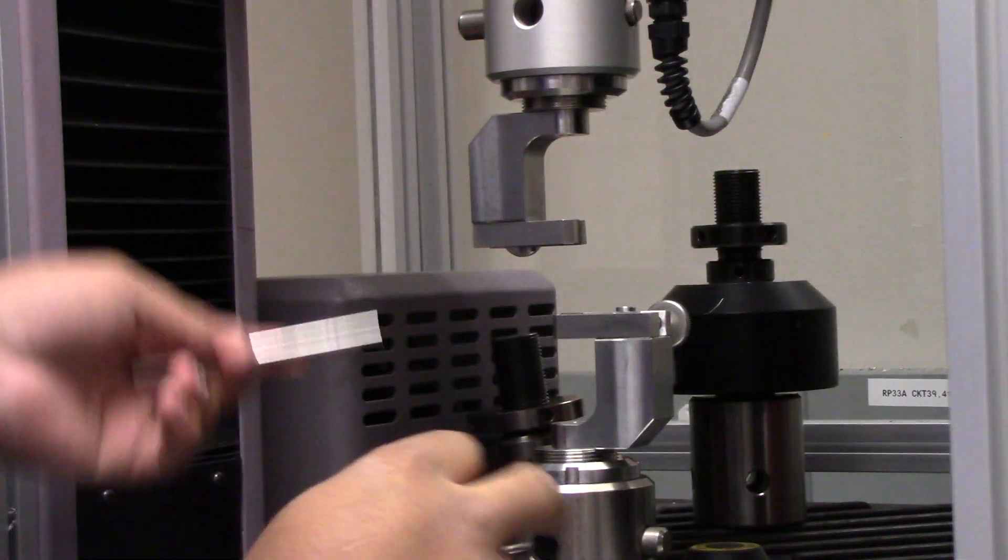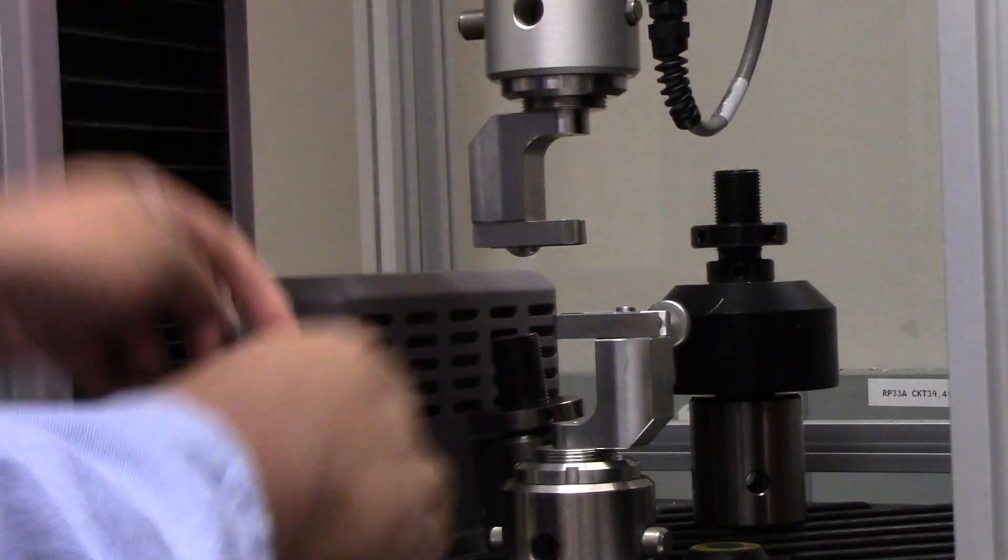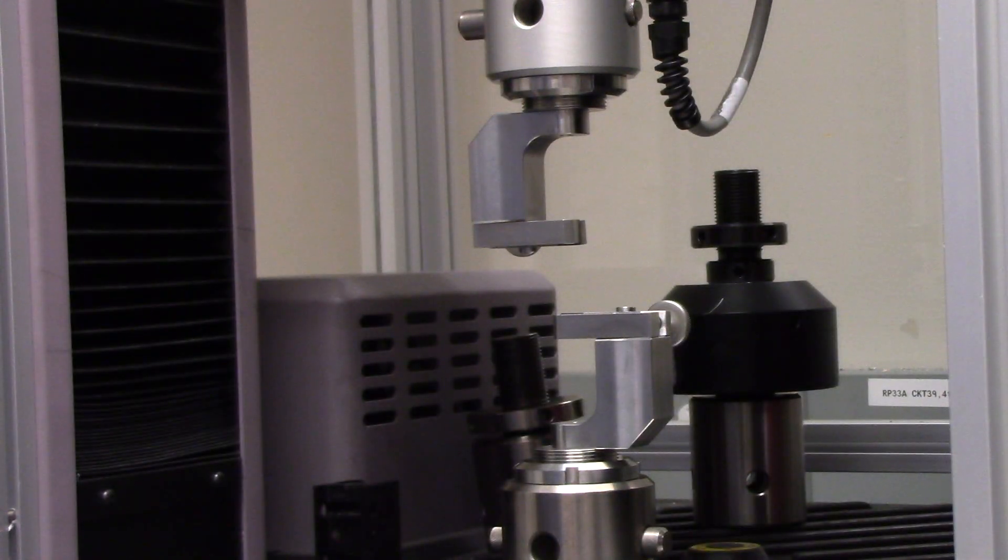Alrighty, now I'm going to just start double checking, making sure everything is nice and tight. Let's go and look at this bottom grip, just give it a little extra tug. And, now you're good to begin performing tests. Now, let me show you how to go back and remove the grips.